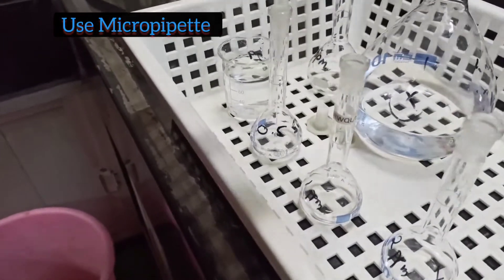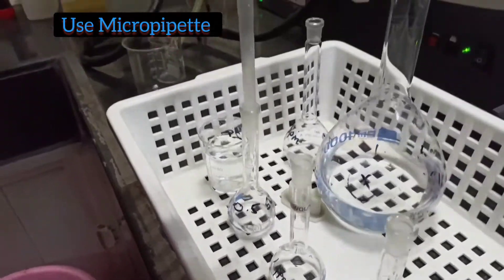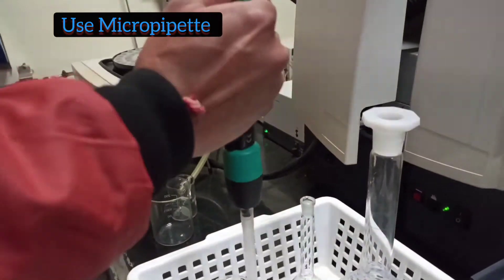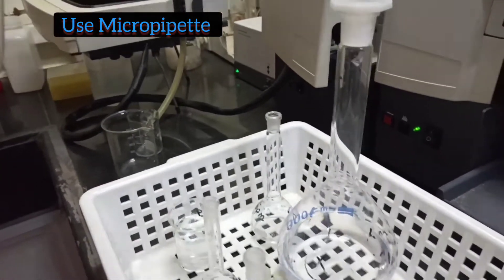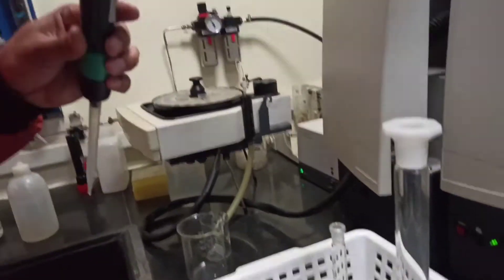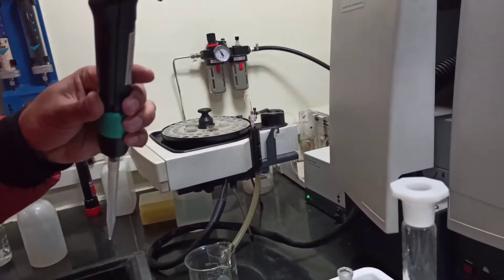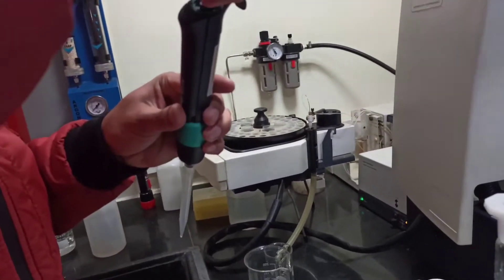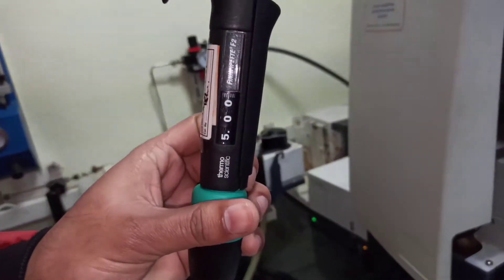Now move to the practical session. For the 0.5 ppm solution, it is very easy to handle and gives accurate results. We adjust to 5 ml — that is our target volume.